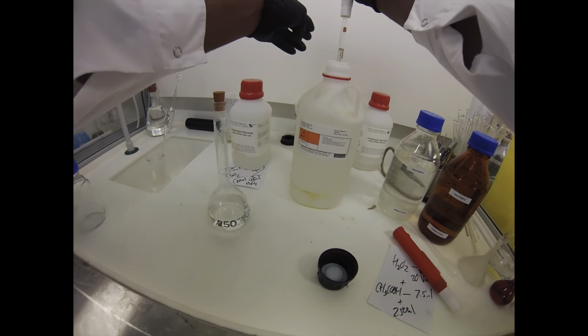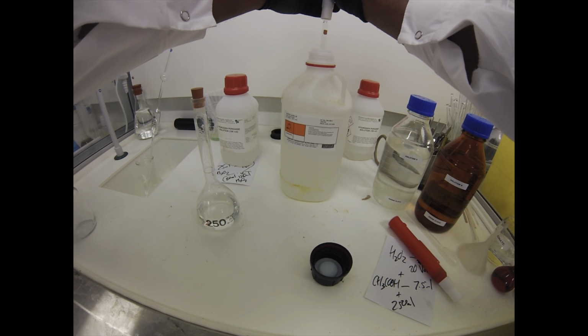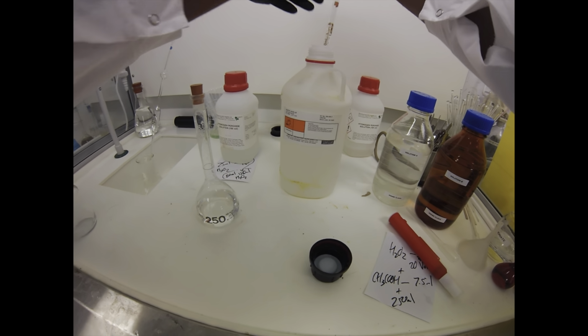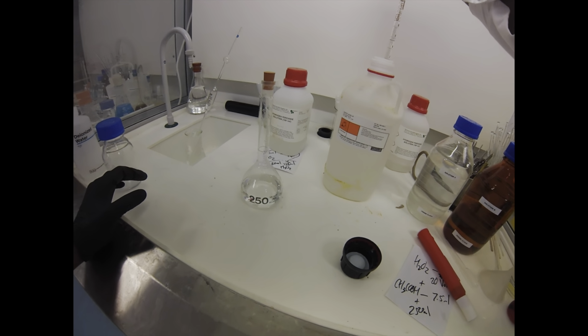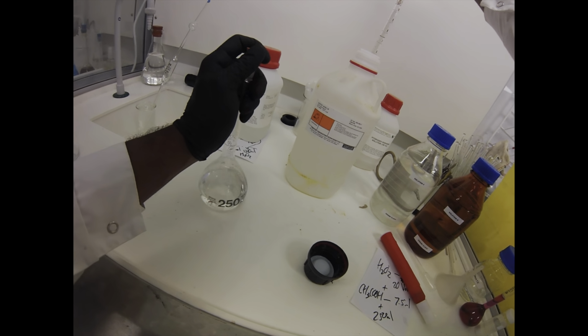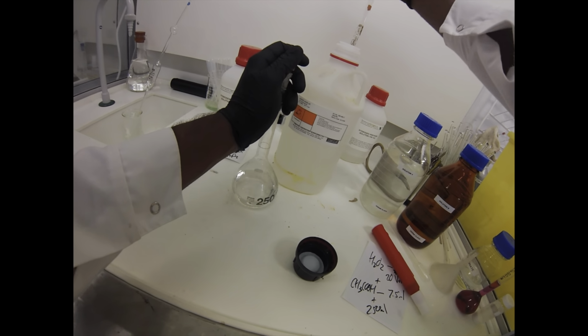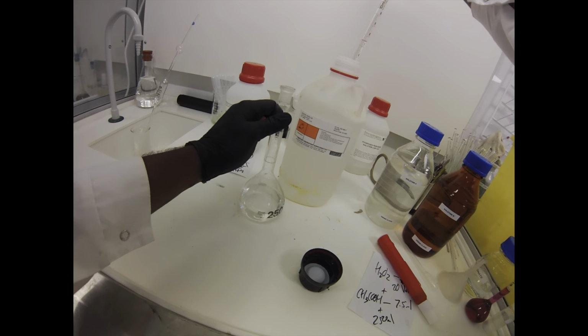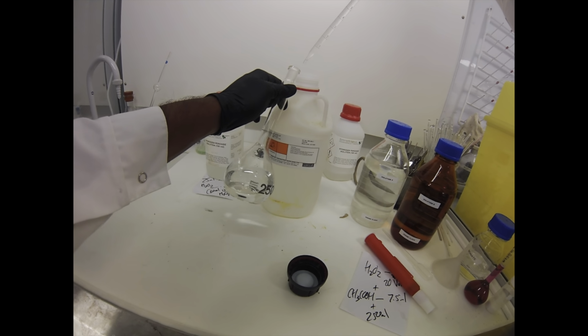Acetic acid is just concentrated vinegar, okay? But it is definitely strong enough to give your nose a real wake up if you're leaning over it outside of the fume hood. So just for everyone's sake in the lab as well, I'm just going to use it in the fume hood. So we'll just draw up 7.5 ml, drop that into the volumetric flask, and then we are good to go.